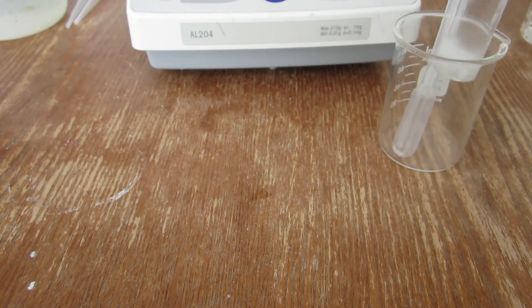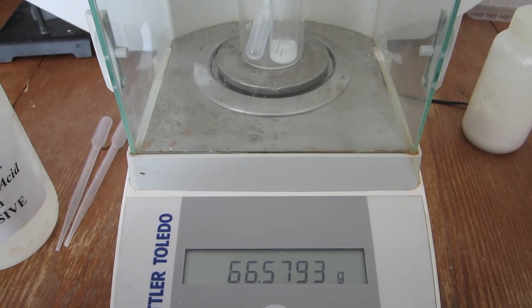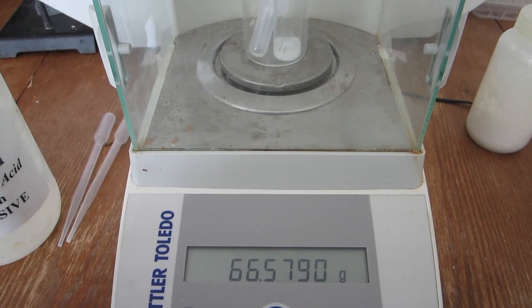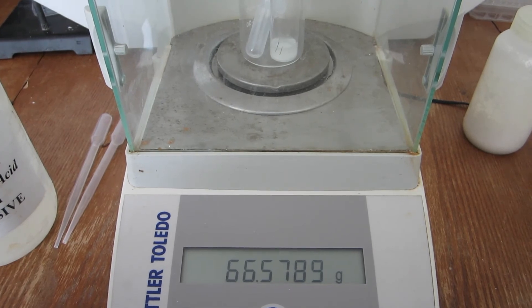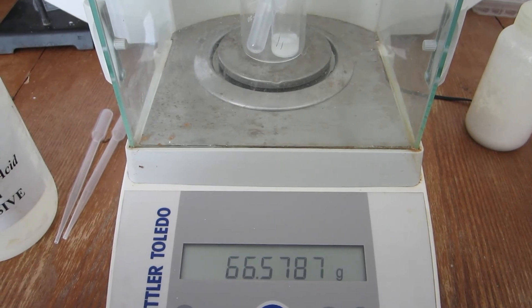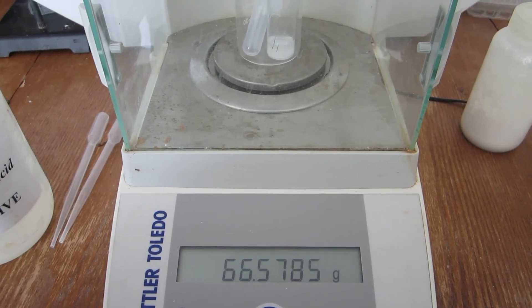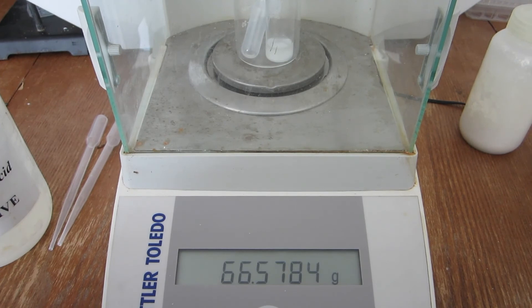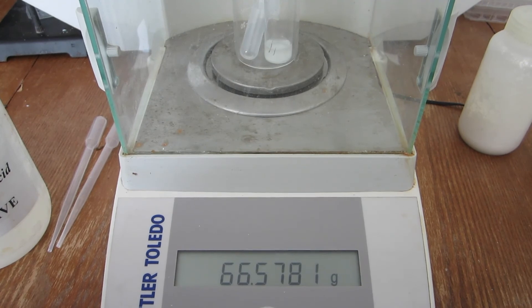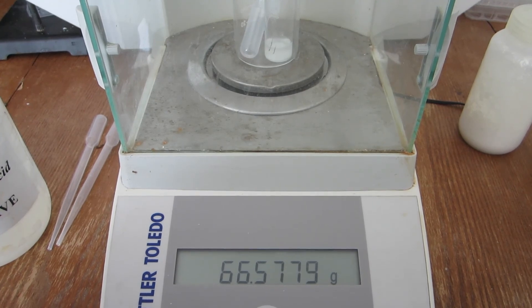After which, the mass can be recorded. The final mass after the reaction in trial number three is now displayed. With each of the trials now completed, you can determine the mass of carbon dioxide, mass carbonate, and percentage carbonate for each of the three trials. Upon taking the average of those three percent carbonate values, you can then compare that to known samples and identify what is this unknown carbonate.